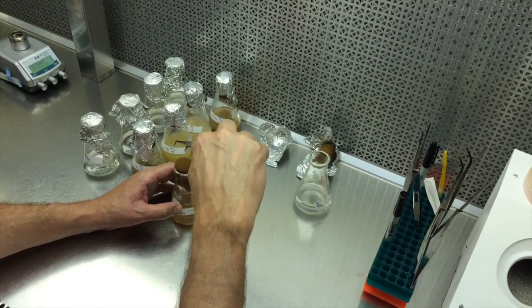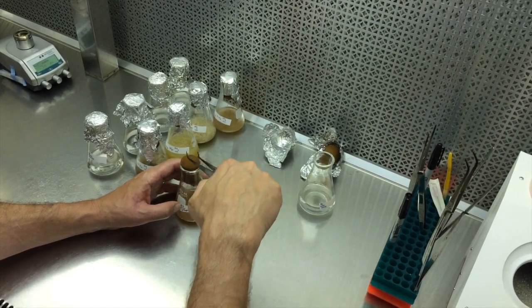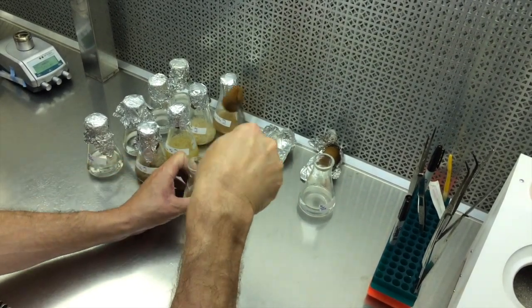Again, don't grab it in the middle, don't grab it like this. You'll pull little pieces of stuffing out of your furniture. Grab it like that, give it a little twist, and it'll pop right out.